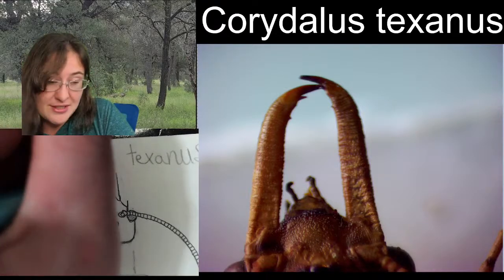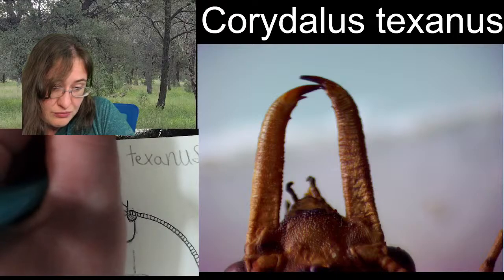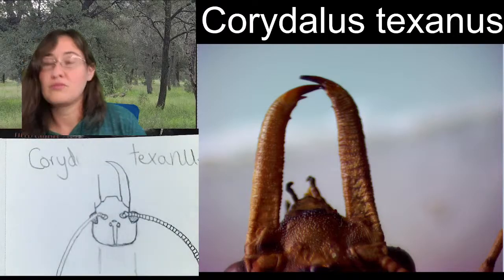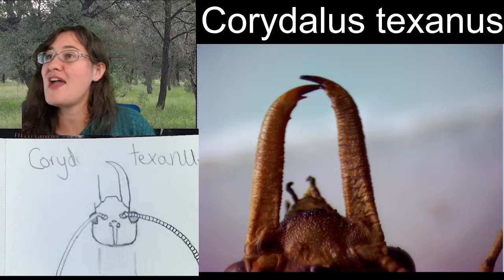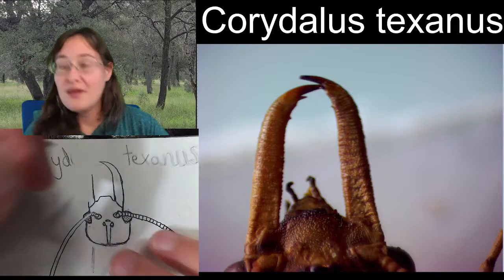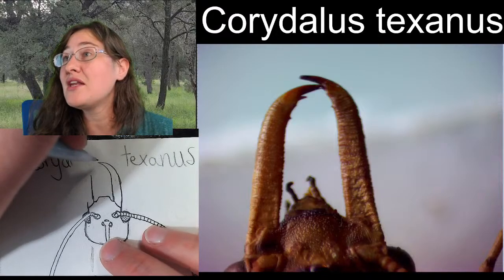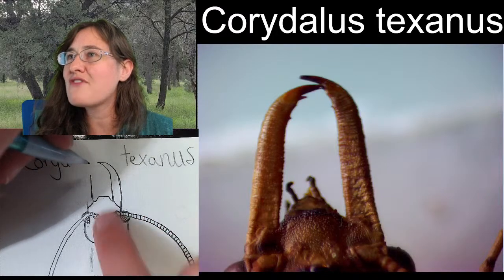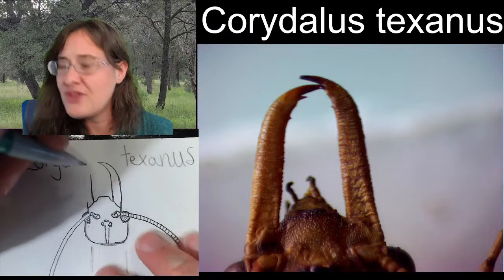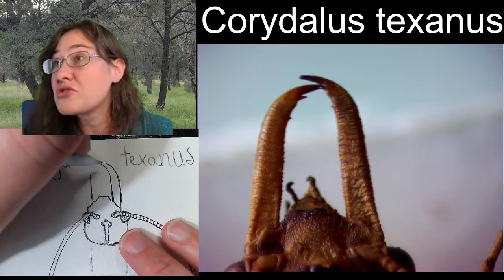The right one is on top. I'm going to go something like that. All right, now this one is coming in. And then we do have a number of smaller spines in here that we're going to be able to also add to our mandibles.